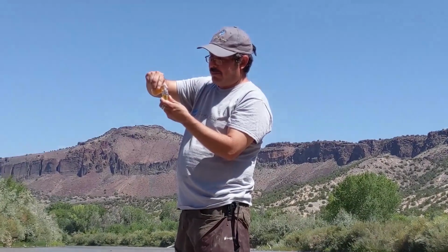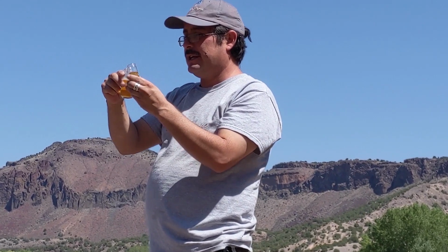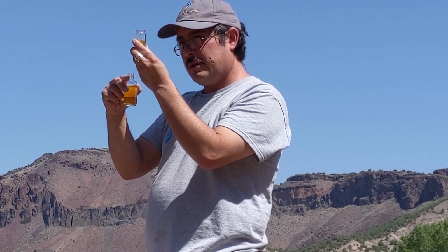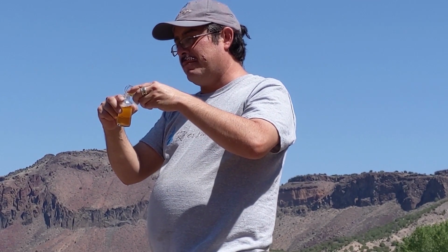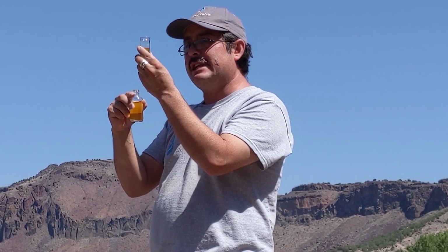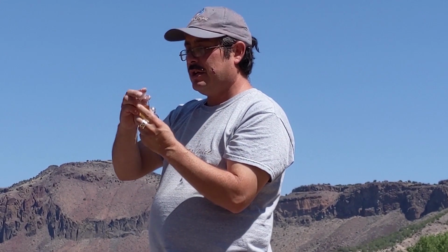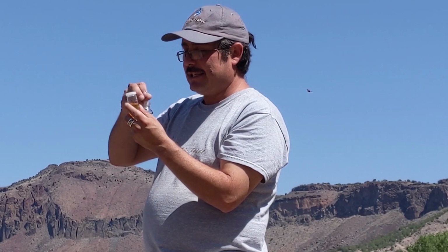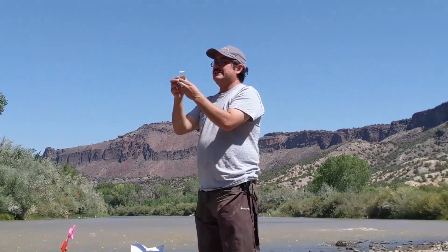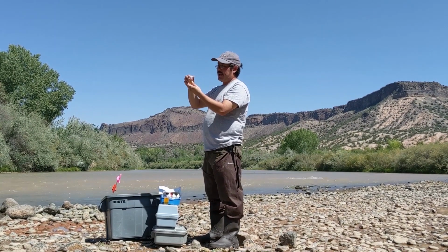And then so I'm going to slowly pour this until we reach that 20 milliliter line. It looks like I poured a little bit too much, so I'm going to pour a tiny bit back. And remember, when you're measuring using glassware, we want to think about a term called the meniscus, the curvature of the water or the solution that we see in the sampling vial. So we want to make sure that meniscus, as it contacts the vial, meets right up to the 20 milliliter line.